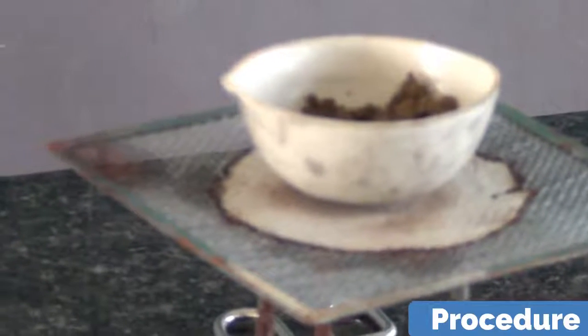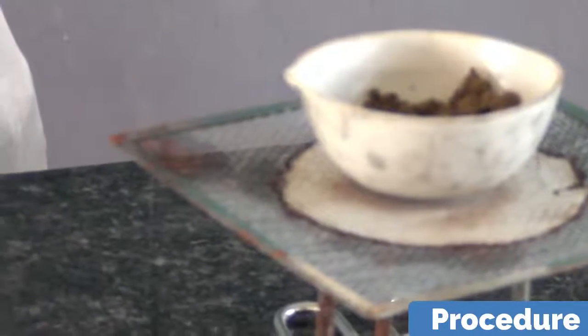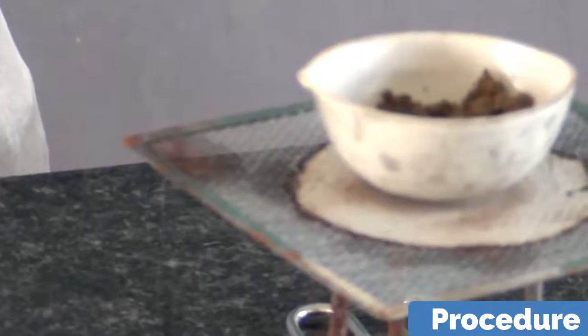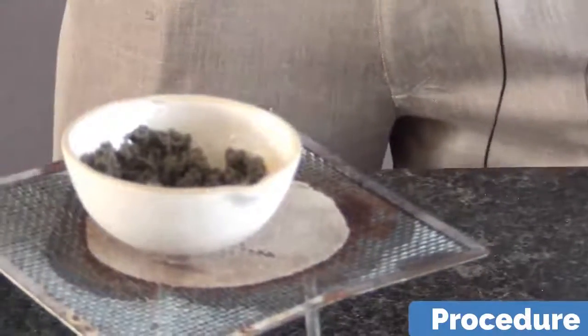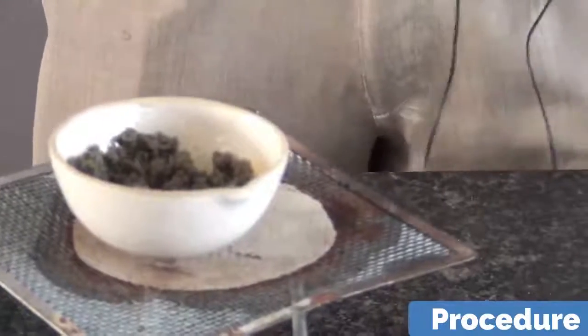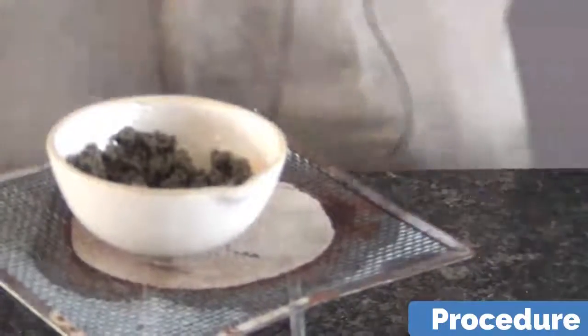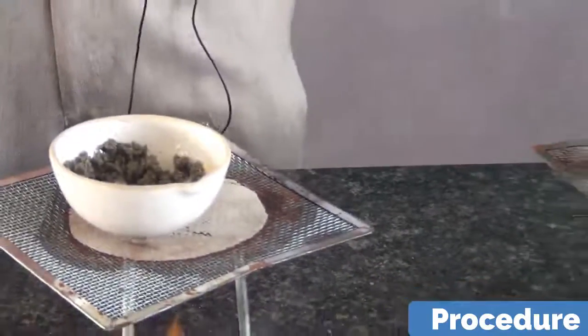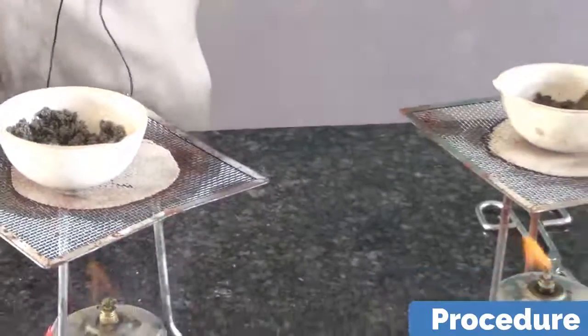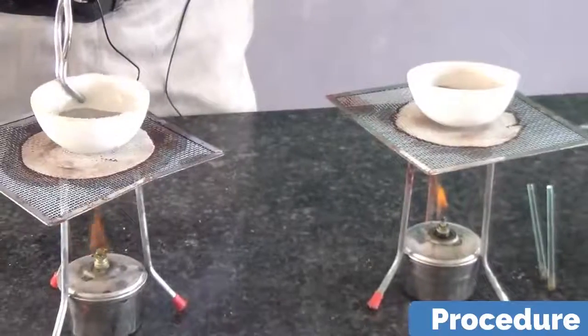You have to repeat it two times if you want to do so. Now the total initial weight of both the soil samples is 25 grams, which we have already weighed with the help of digital balance.